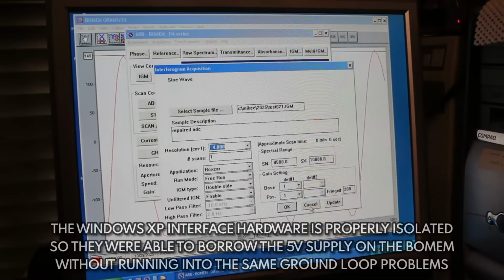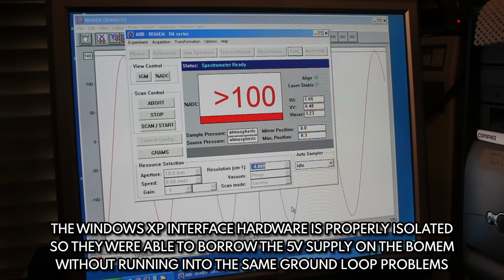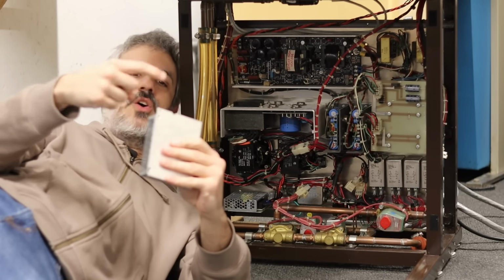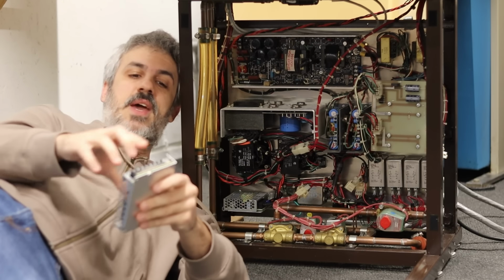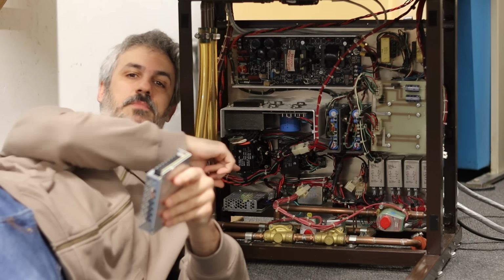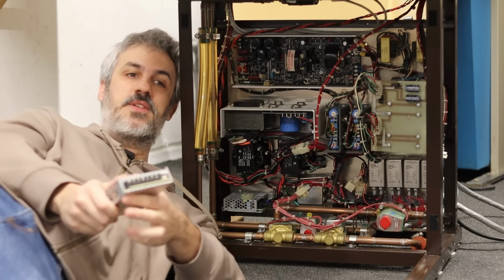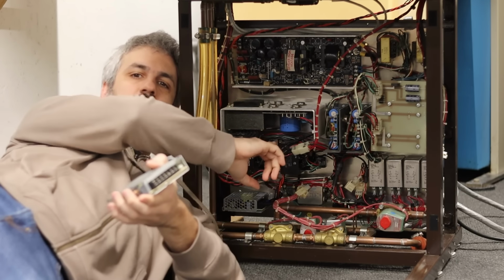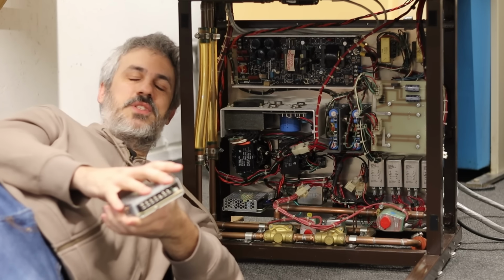Maybe they were plugging it into a more modern system so they were able to get away with it or something like that. But I've got a spare Mean Well here. I'm going to try and slip this in there, hook the line and neutral up to it, and then have this be the supply for everything else, and then that smaller one be the supply for just the opto-isolator. So that way it's fully isolated. But that means I gotta get this whole power supply unit out, which is a giant pain.